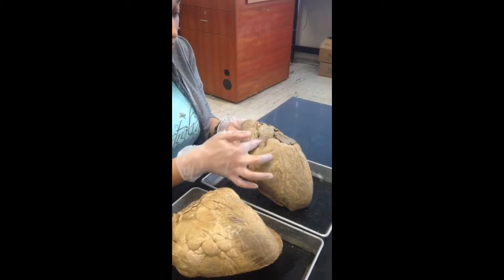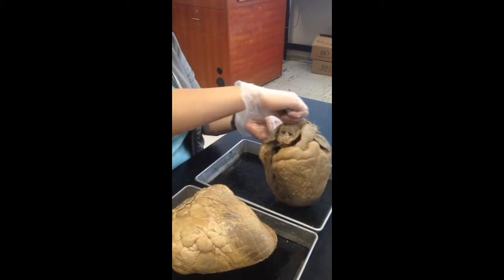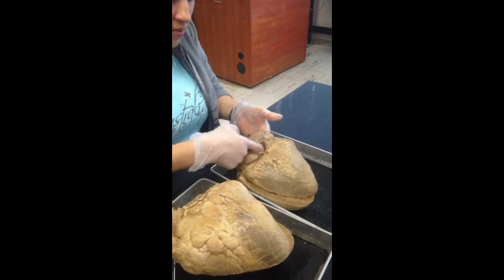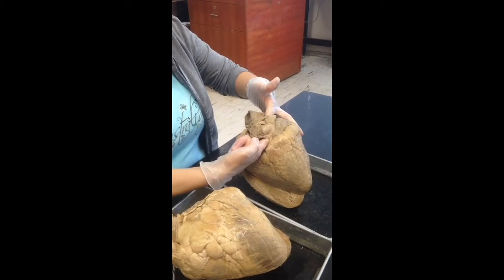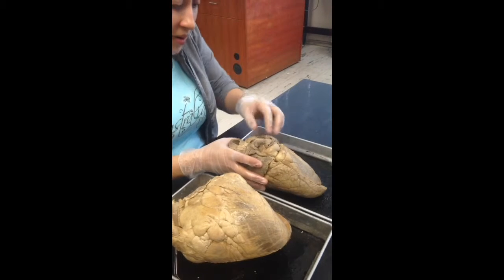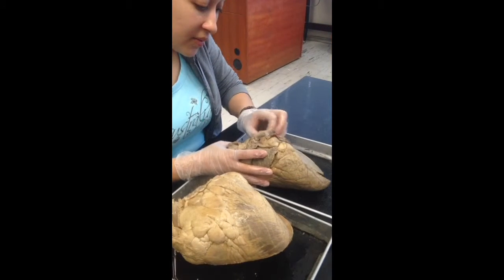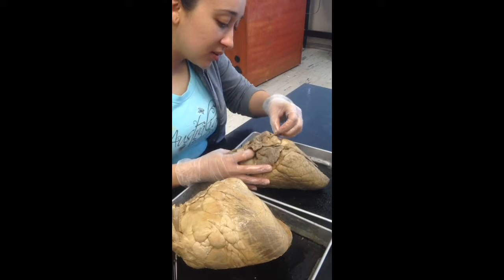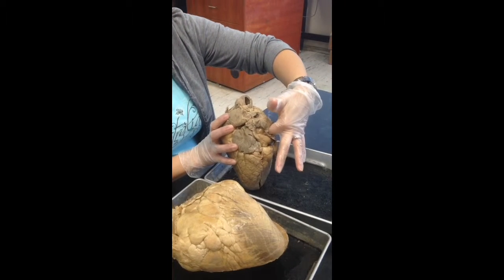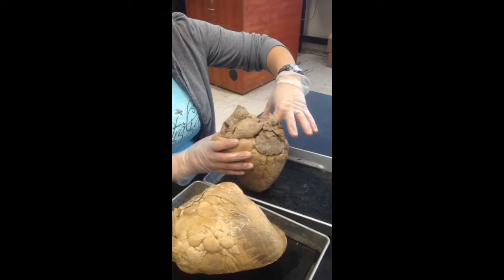This is the pulmonary trunk, the aorta. So you look at the back. Put my fingers through here, superior and inferior vena cava. And then you have to kind of find the opening. Okay, this will be a pulmonary vein, and that dumps blood into the left atrium.